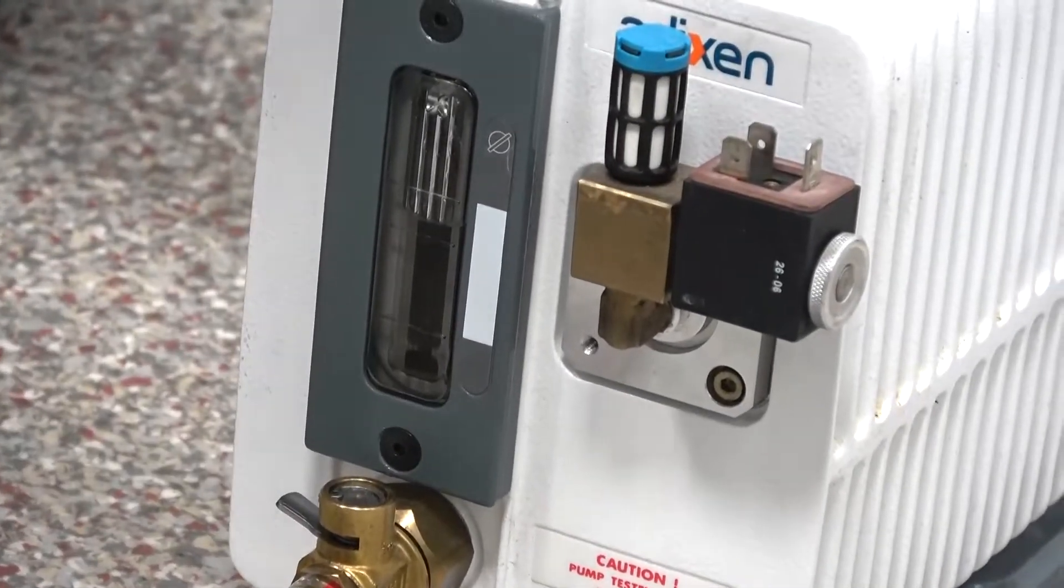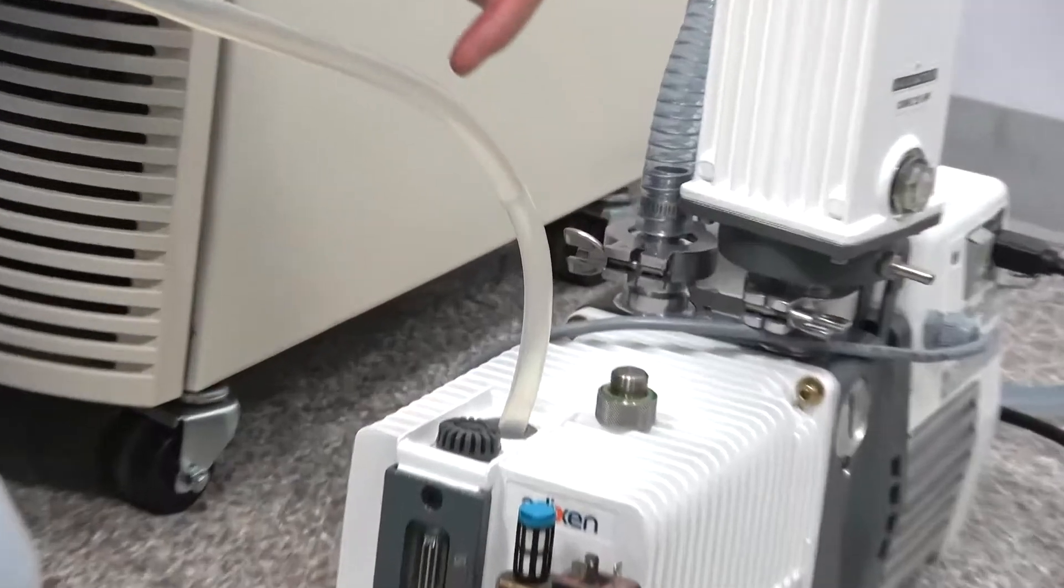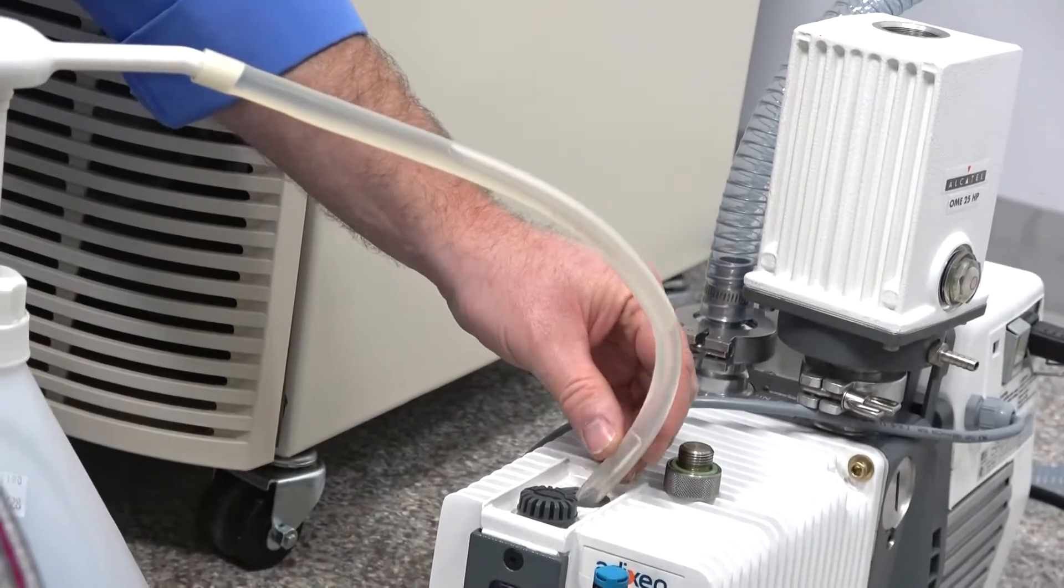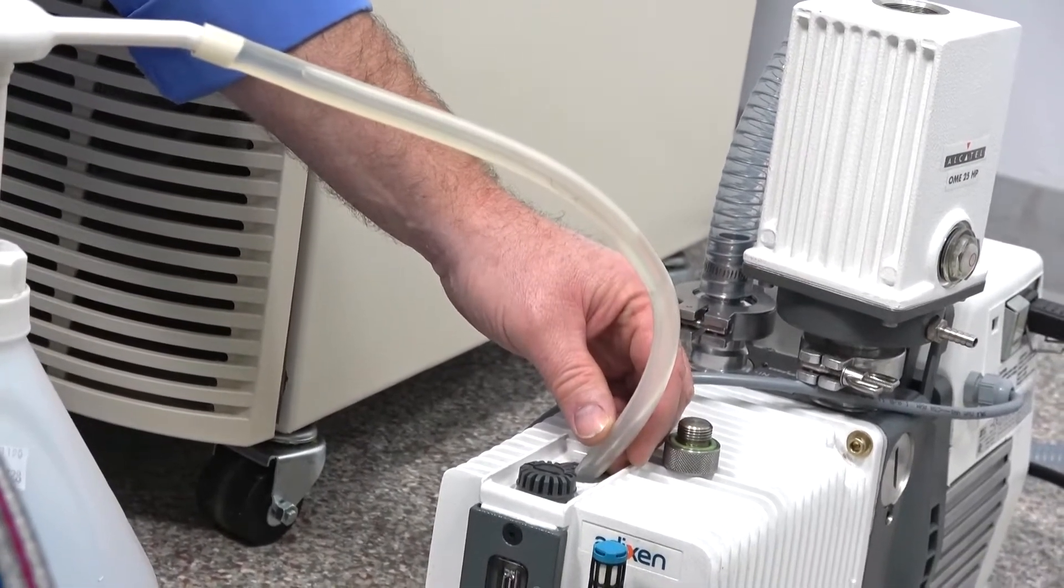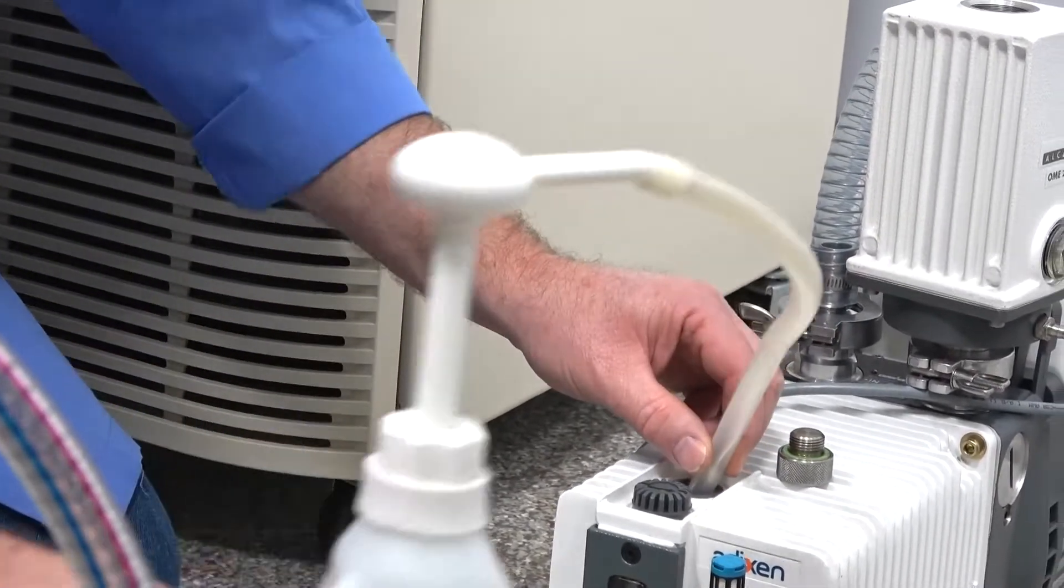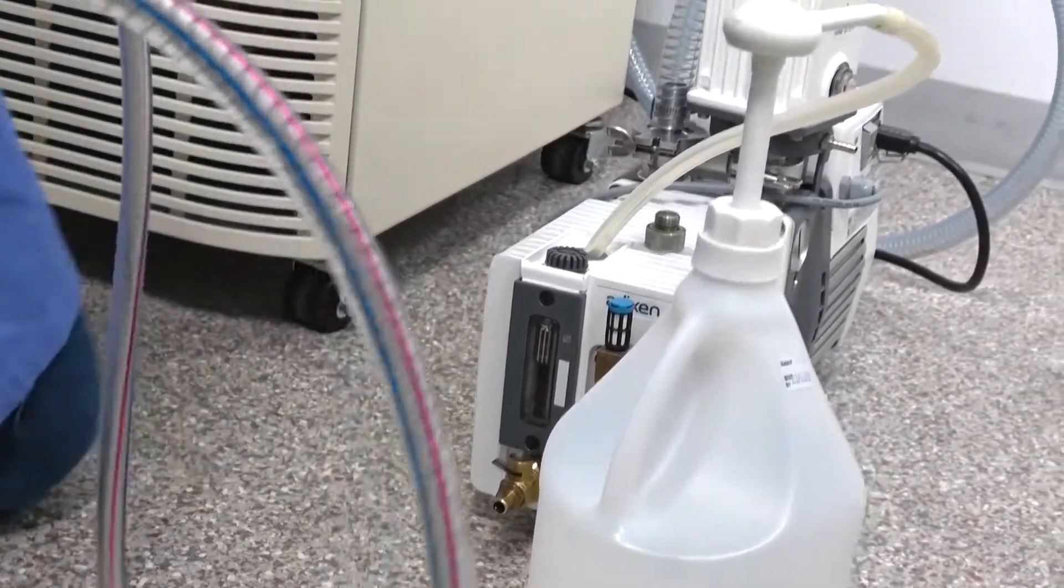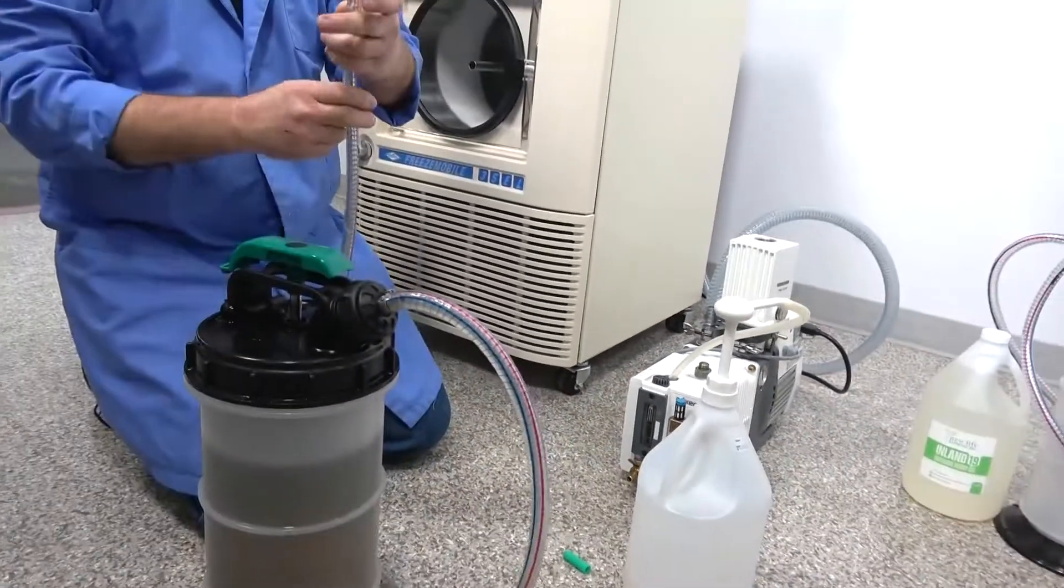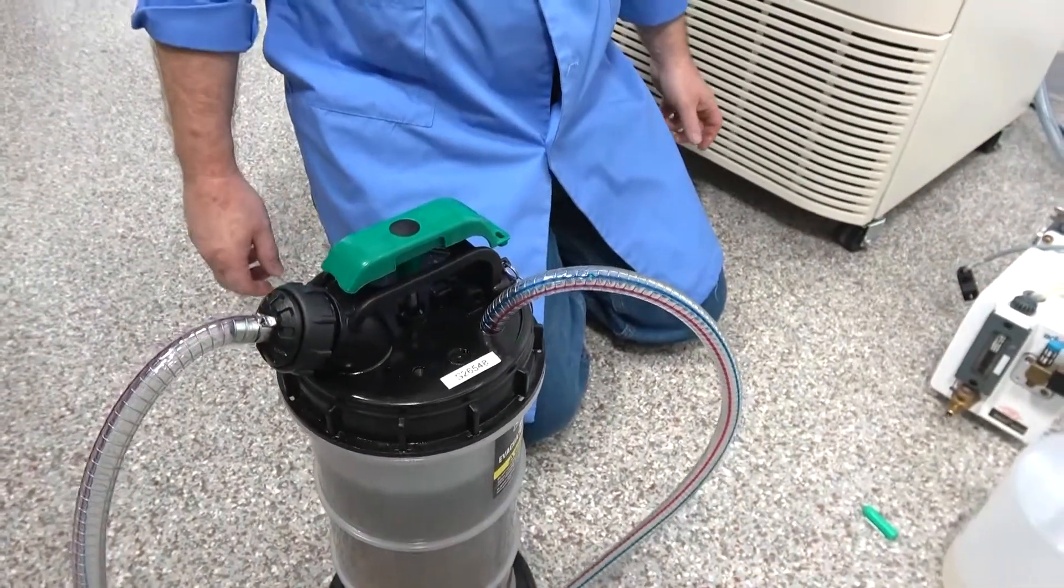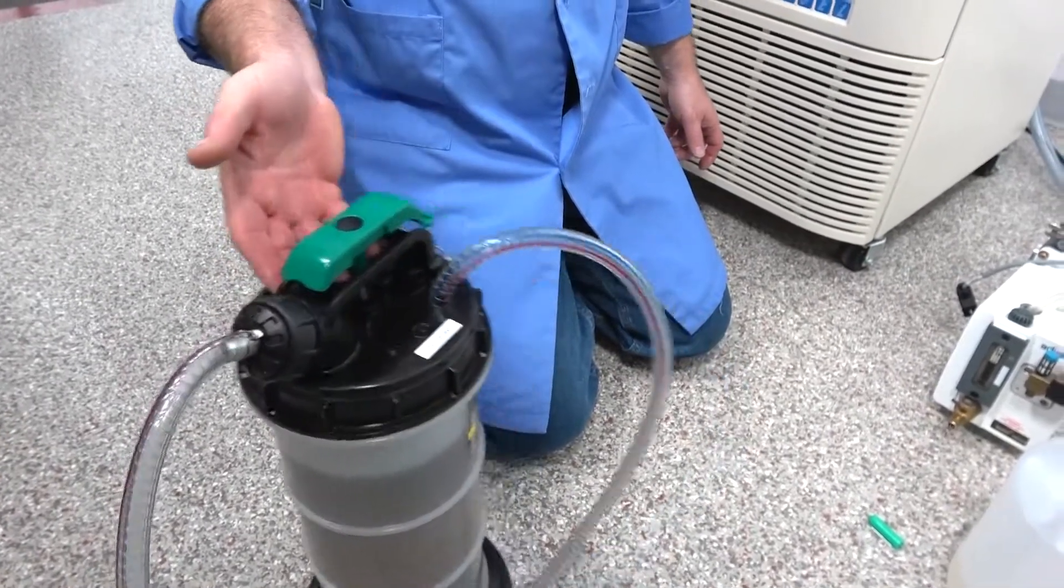And now I'm just going to let the excess oil drain out of my hose there. You can see how it just simply drains down like that. Just wait a bit there, and give this a couple more pumps too. And while that's draining there, I'm just going to unplug this, and you can see it just kind of sucks it. And then there's a nice little hole right here, just to stick that down in there. So if you do get a little oil residue in there, no problem.